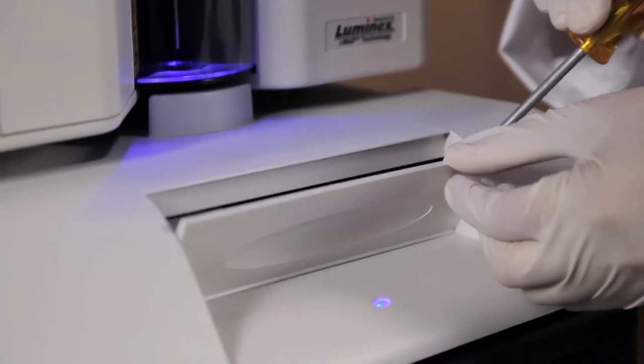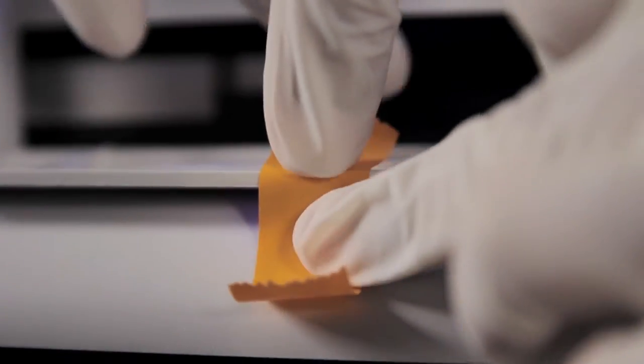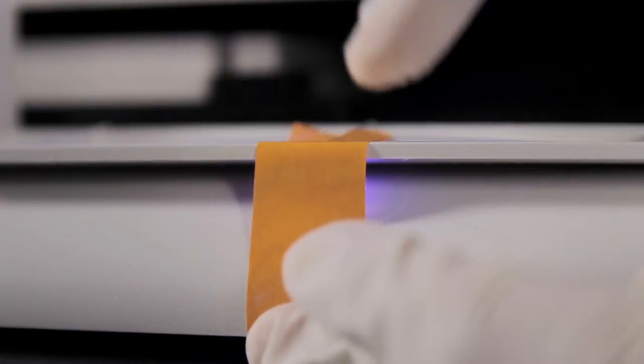It will be necessary to see inside the access door while adjusting the needle height, so tape the access door of the microplate platform in the open position.